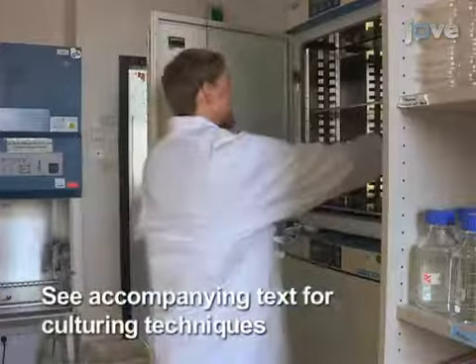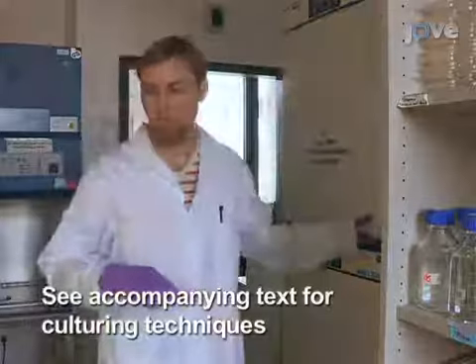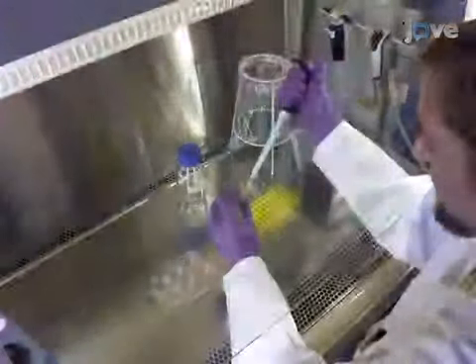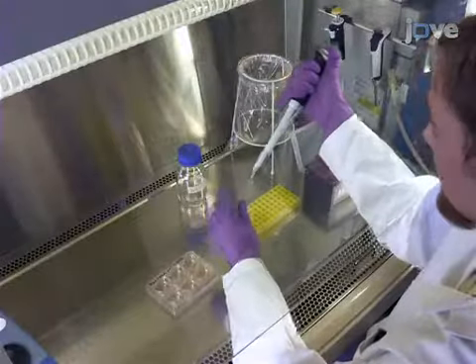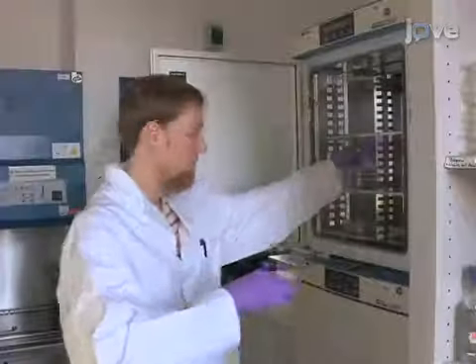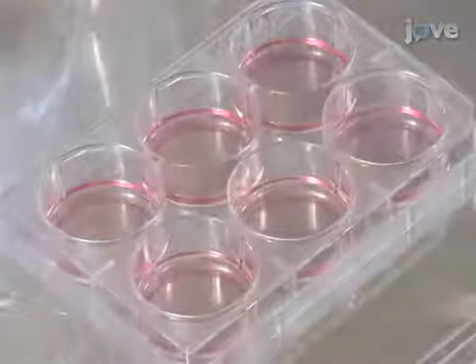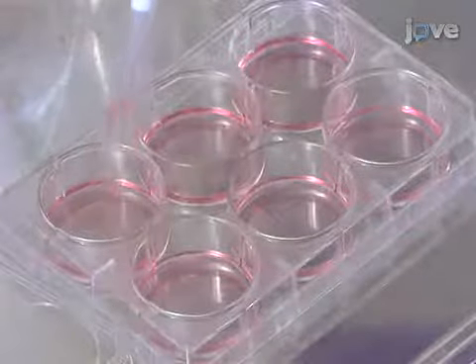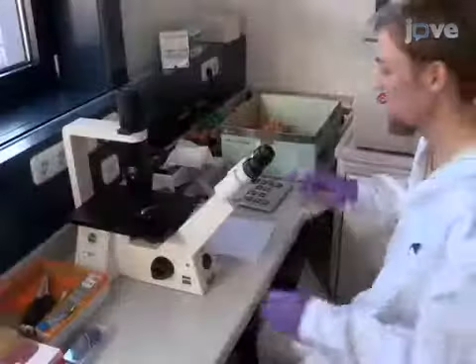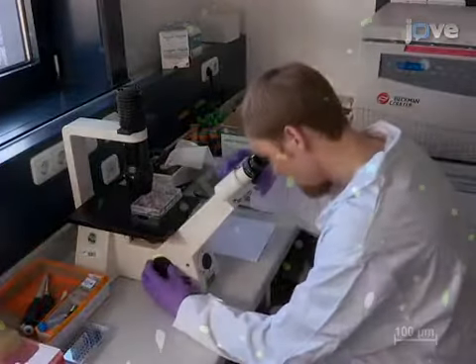Next, remove HEK293A cells grown to 50% confluency on 6-well plates from the incubator. Dispense the solution dropwise into the wells containing HEK293A cells and incubate them at 37 degrees Celsius and 10% carbon dioxide. Add 0.5 milliliters of fresh medium every 3 days. Using GFP expression as an infection marker, evaluate the transfection efficiency visually with an inverted fluorescence microscope.